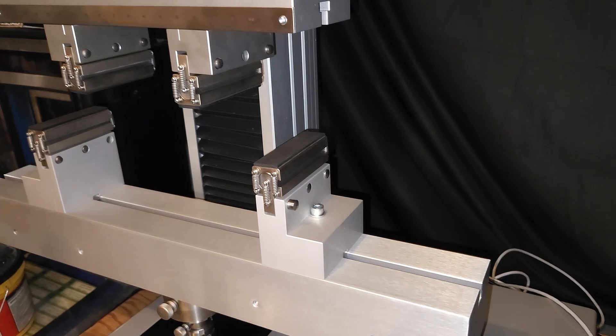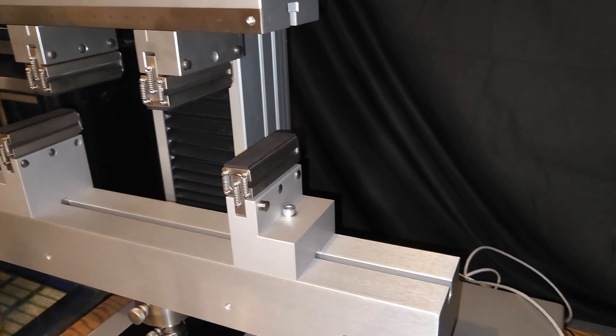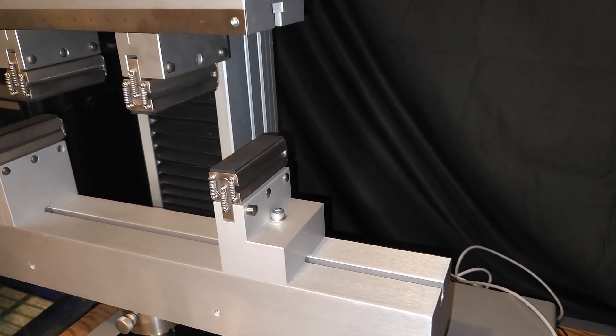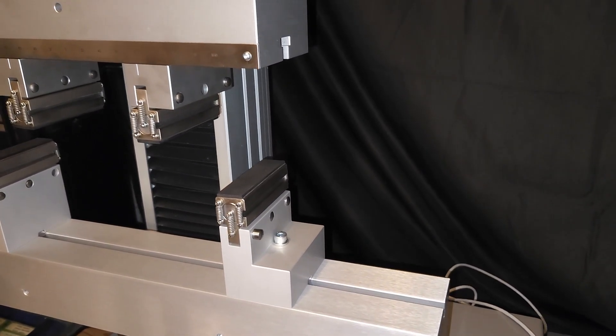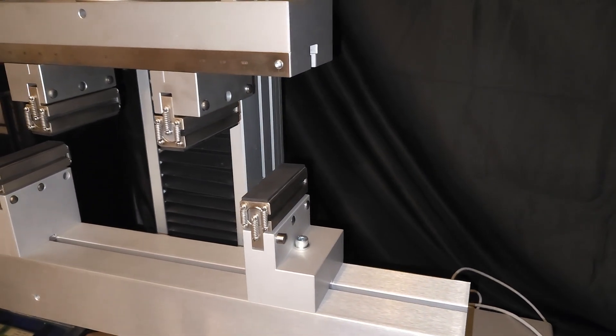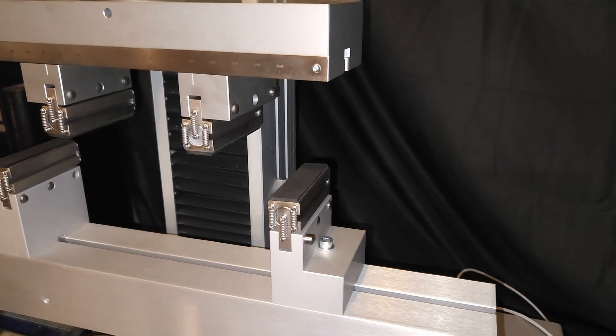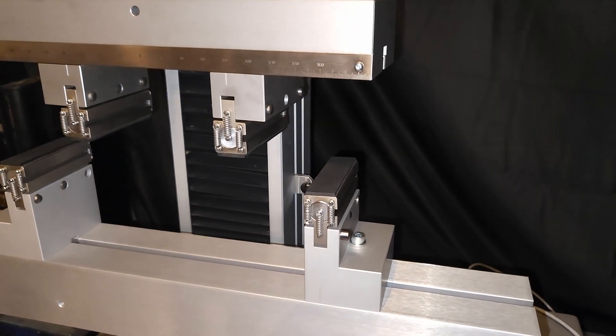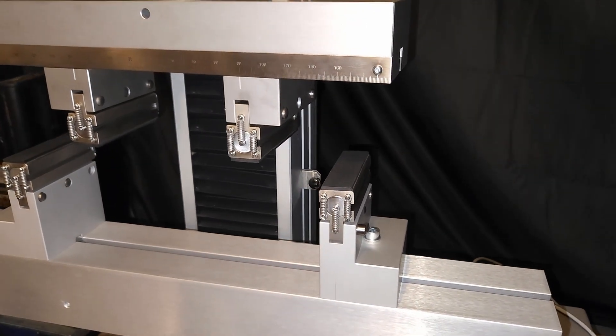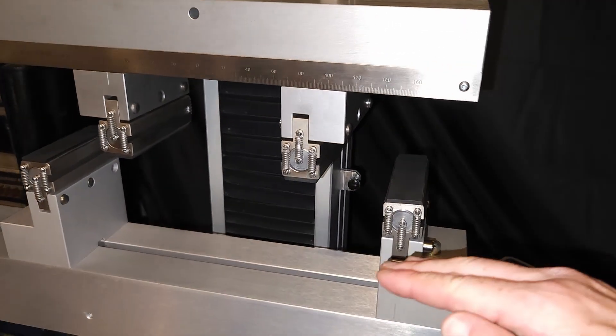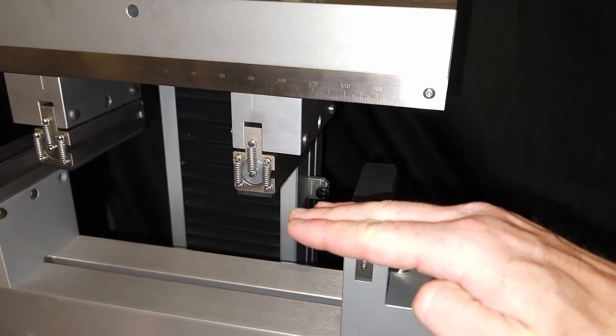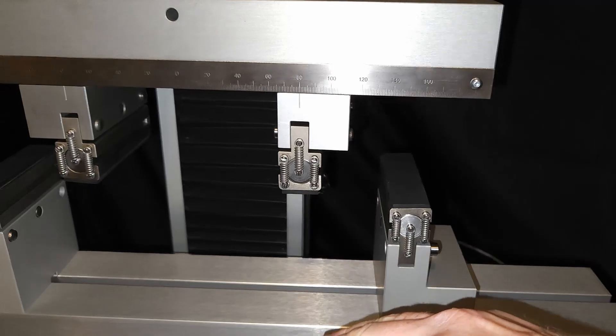And when we go ahead and initiate the test, we can move the crosshead up and down. So the crosshead would come down on the sample right there and bend and eventually rupture the sample.